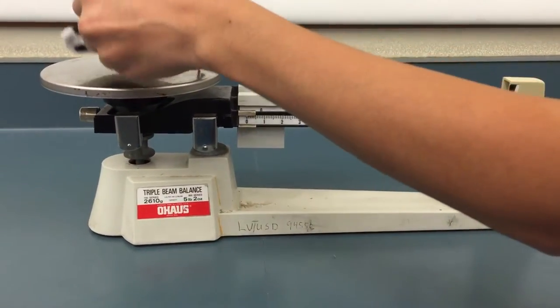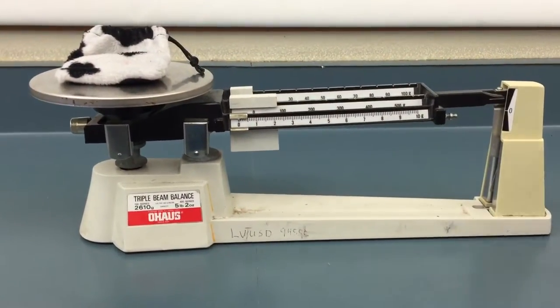So I'm just going to put this right in the middle of the base, the pan, or the stage. And it just went up.